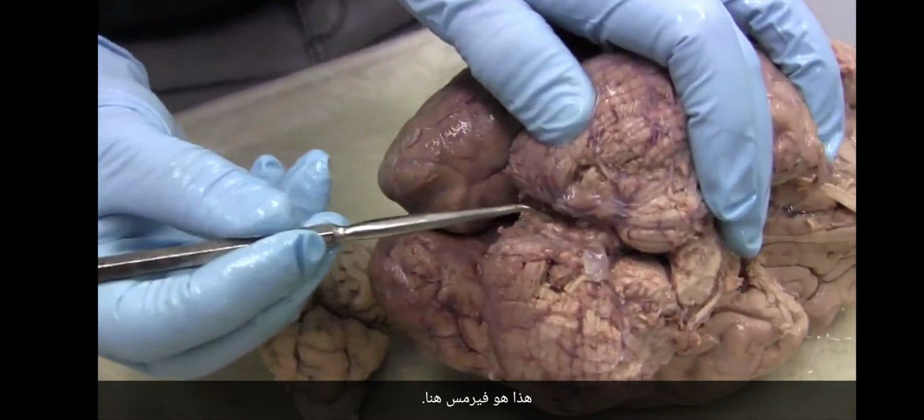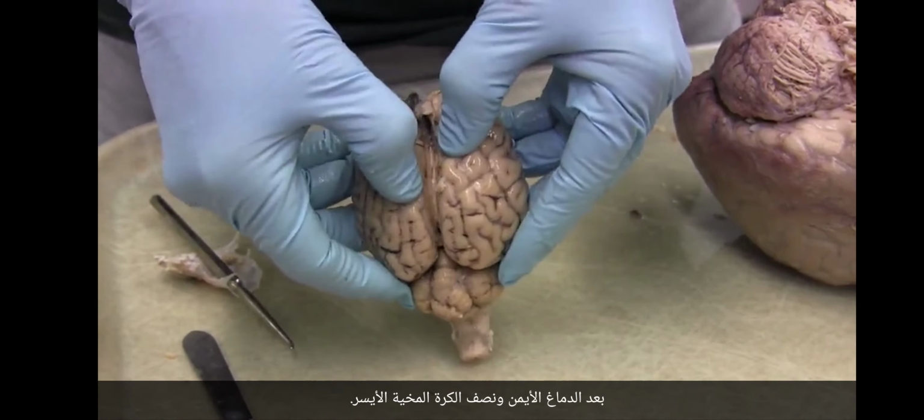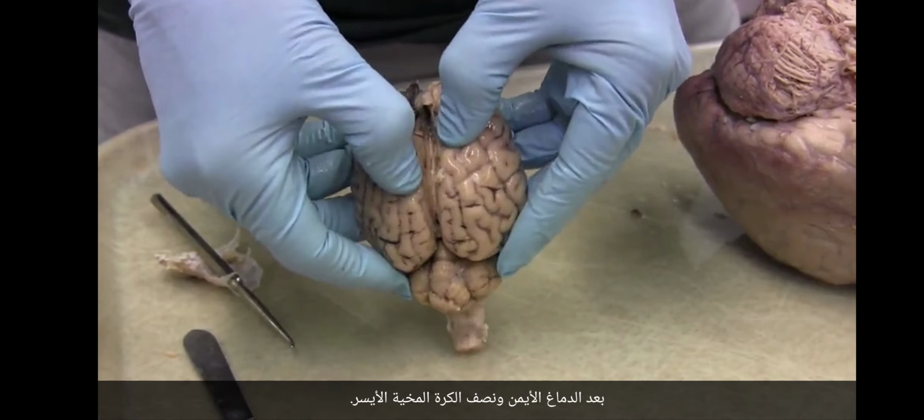Okay, so now let's see, is the inside, is the brain similar in the sheep as it is in the human? It is. So we're going to look at how the telencephalon comes back on top of the diencephalon and the rest of the brain. So the first thing that we have to do is split these hemispheres, and just like in the human, there's a right telencephalic hemisphere and a left telencephalic hemisphere, and so we can look down, and when we look down, what are we looking at? We're looking at the corpus callosum, that connection between the two sides.